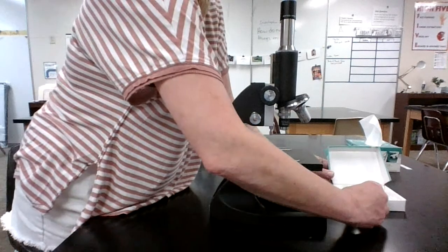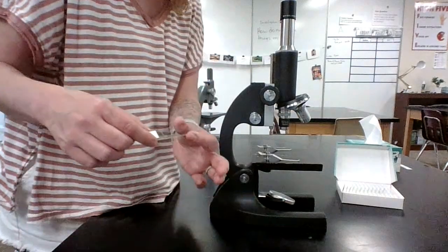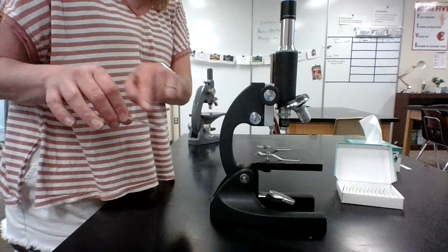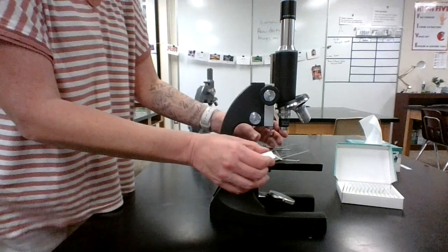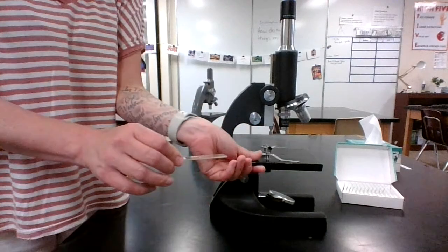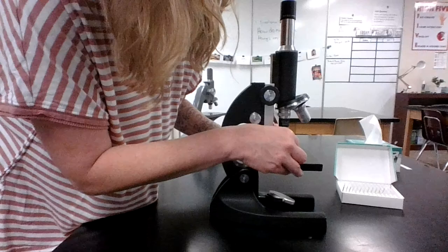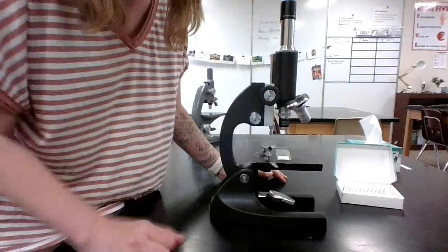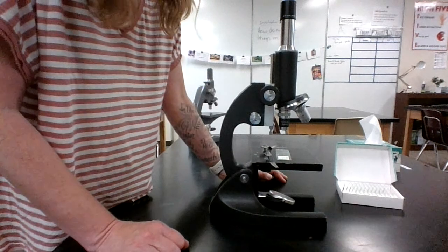I'm going to carefully pick up whatever slide my teacher's telling me to use, and I'm going to hold it by the edges. I'm going to make sure that there's nothing around me that can trip me, and I'm not going to touch the slide specimen itself. I'm going to make sure that my stage clips are out of the way, and I'm going to try to center this on the opening there in the stage so I know that it's in good shape, and I can actually see that light kind of shining on the specimen. If you can't, that's okay, but in this case I can.